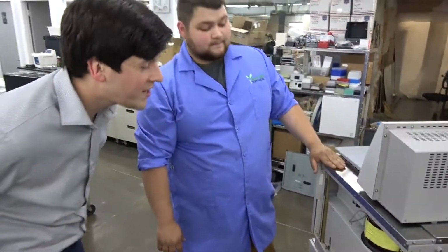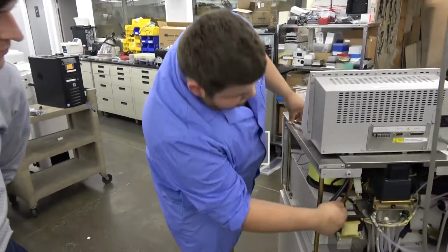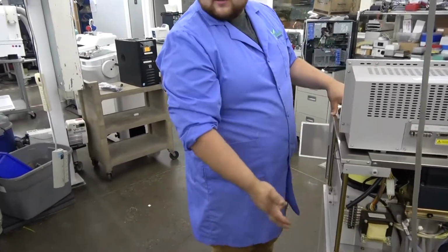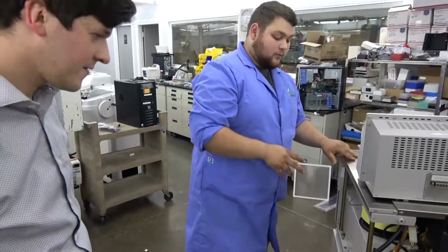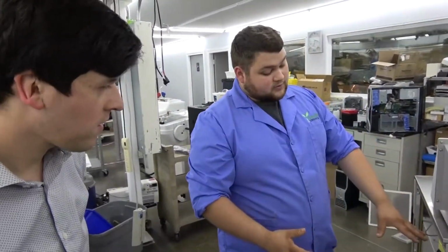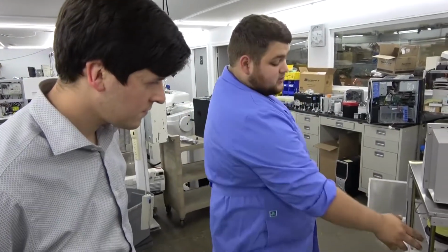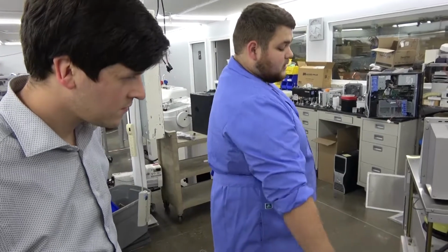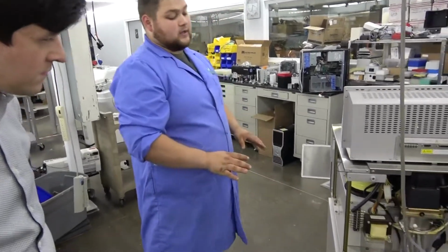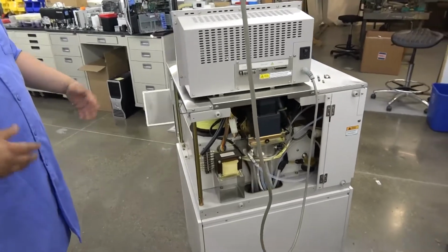Why did you put this on a platform? So the wires going to this weren't long enough to set all the way down. We were originally trying to turn this top transformer on its side or do something like that. And we had the idea if we put this transformer down there, it gave it a cleaner look and still allowed space for repair if it ever needed it.